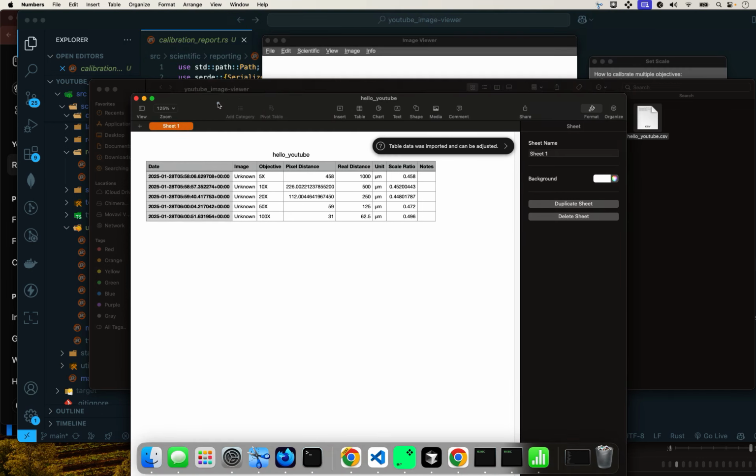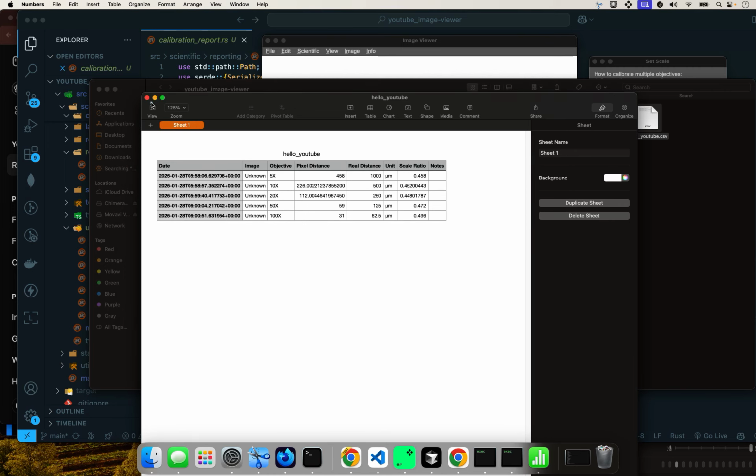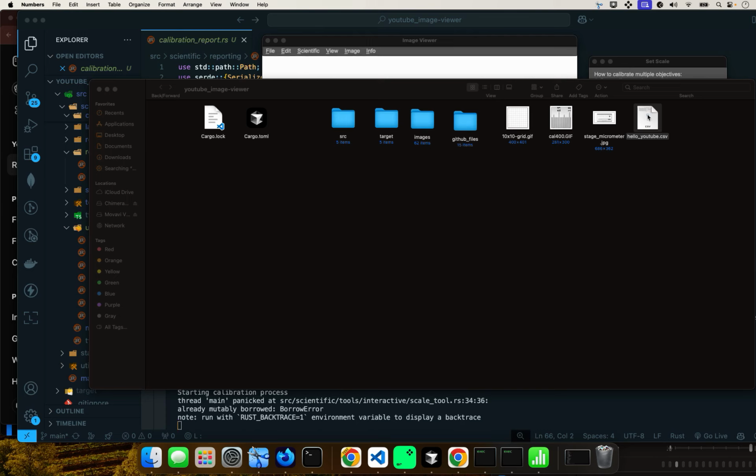You have this nice report that you can keep with your report. And the most important thing, if you're using a microscope, you will see that it's more or less half. So half of this is more or less half of that, more or less half of that. It's not going to be exact, but it's just a proof of concept. But if you look at the scale, it's pretty close. I mean, it's not exact, but it's pretty close. Okay, and that's what this code will do. It could be very handy for certain applications.